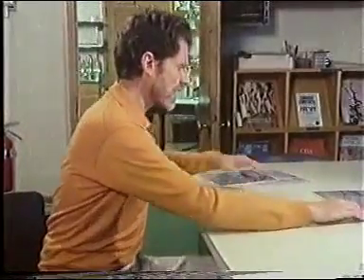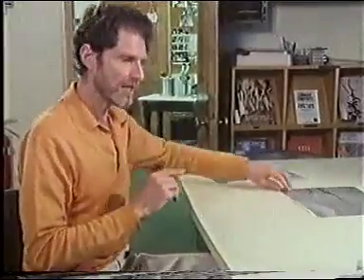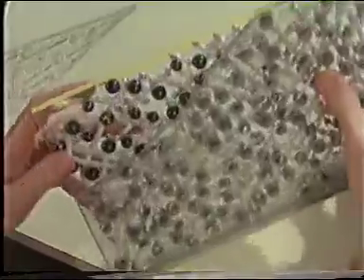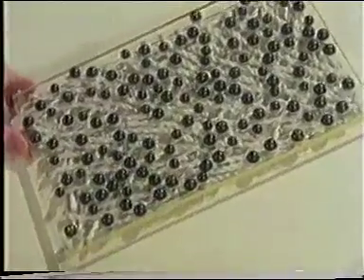And the first indication of what was going on came by examining electron micrographs showing membranes that had been cross-fractured in one region and face-fractured in another region. It became clear when we looked at these that if this was a bit of membrane, what was happening was that the membrane was actually being fractured. A portion of it was being removed so we could see inside the membrane. Often we got a vast exposed region of the membrane.